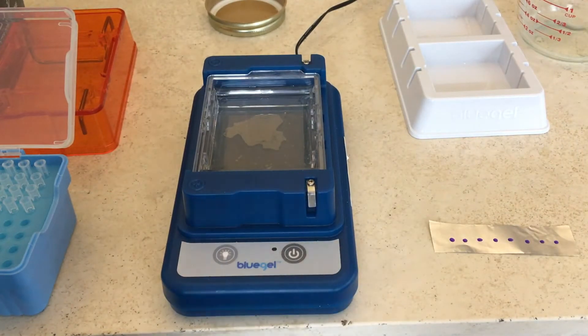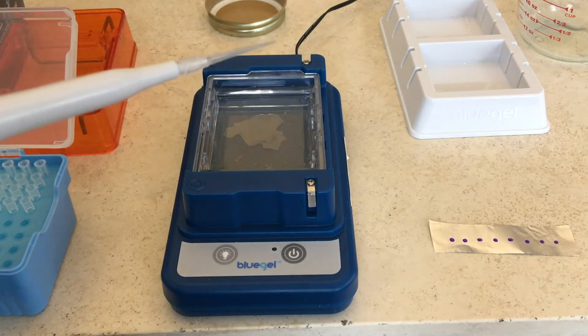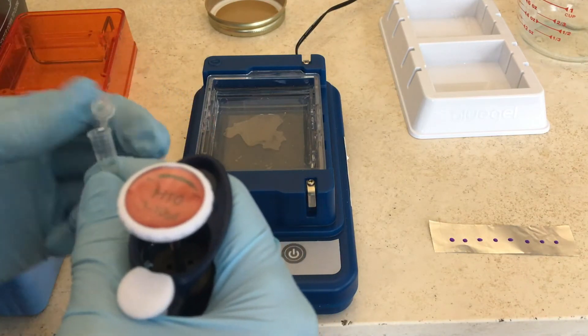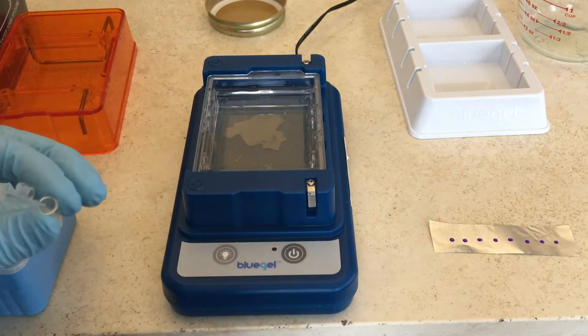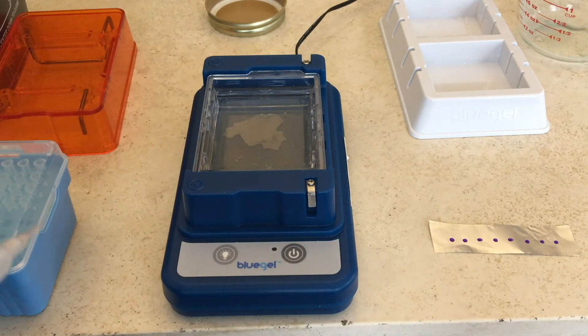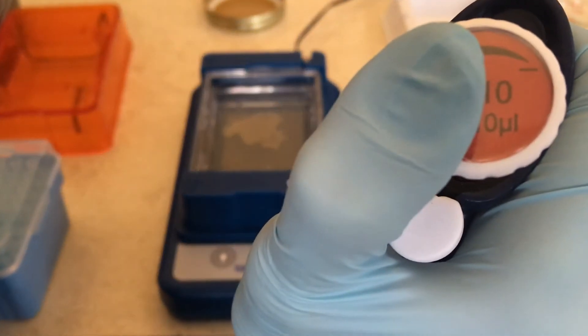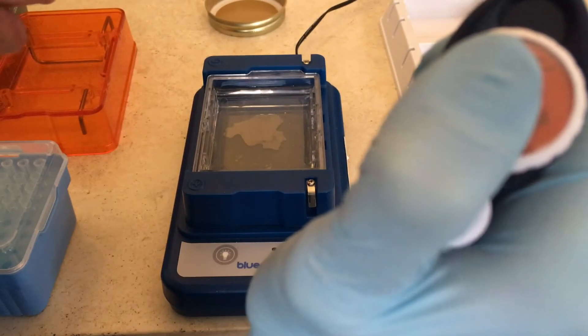The next step is a little bit more challenging. What we're going to have to do is put on a fresh pipette tip for each of the mushroom samples and we're going to take one of these, open it up, take about six or seven microliters of the contents. I'm just setting it and then we're going to put that on top of one of those drops and mix it a little bit with the tip of the pipette.